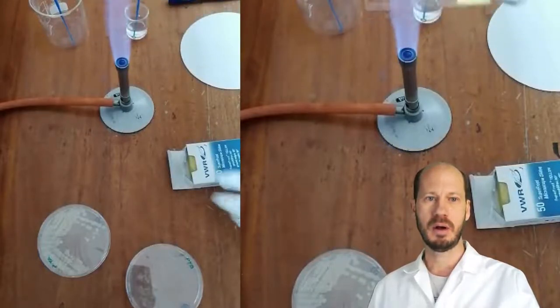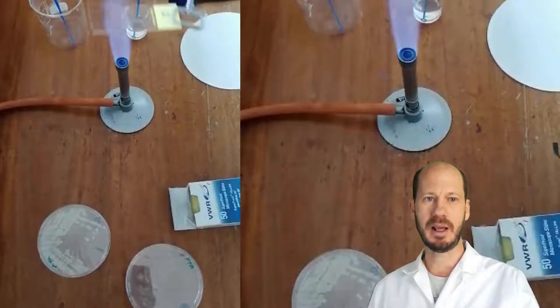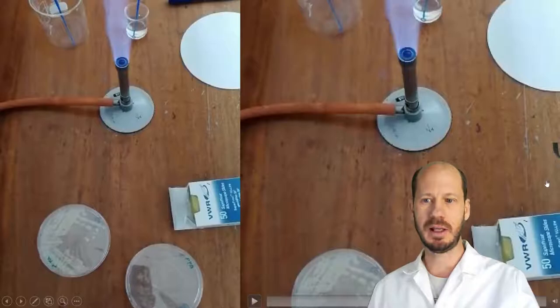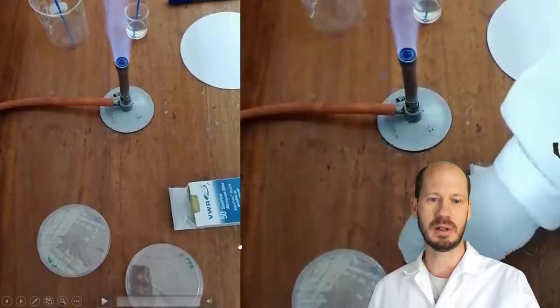This is what you see now. Putting the slide over the flame, quickly passing from one side to another. That is the process of heat fixing those slides.